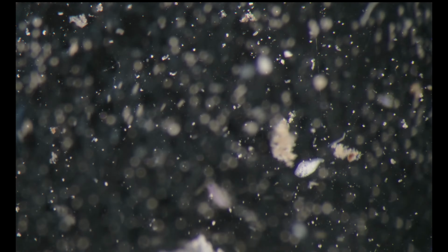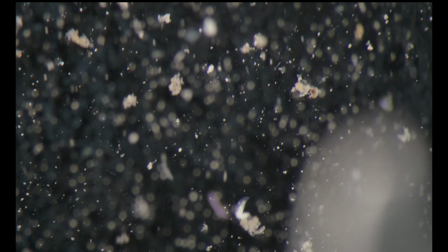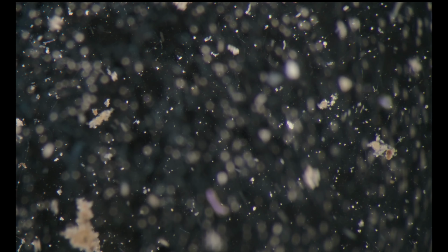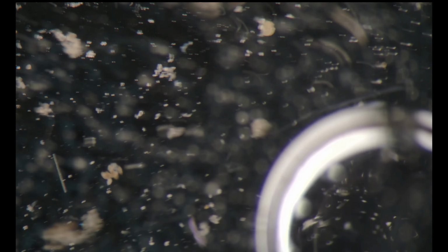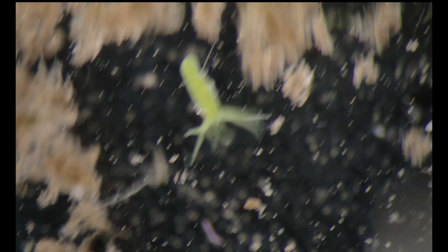See, I'm using it very carefully around the specimen. And I've detached the Loxophyllum from the substrate, and I can now take it carefully and free it. Let's see if we can find more interesting things.